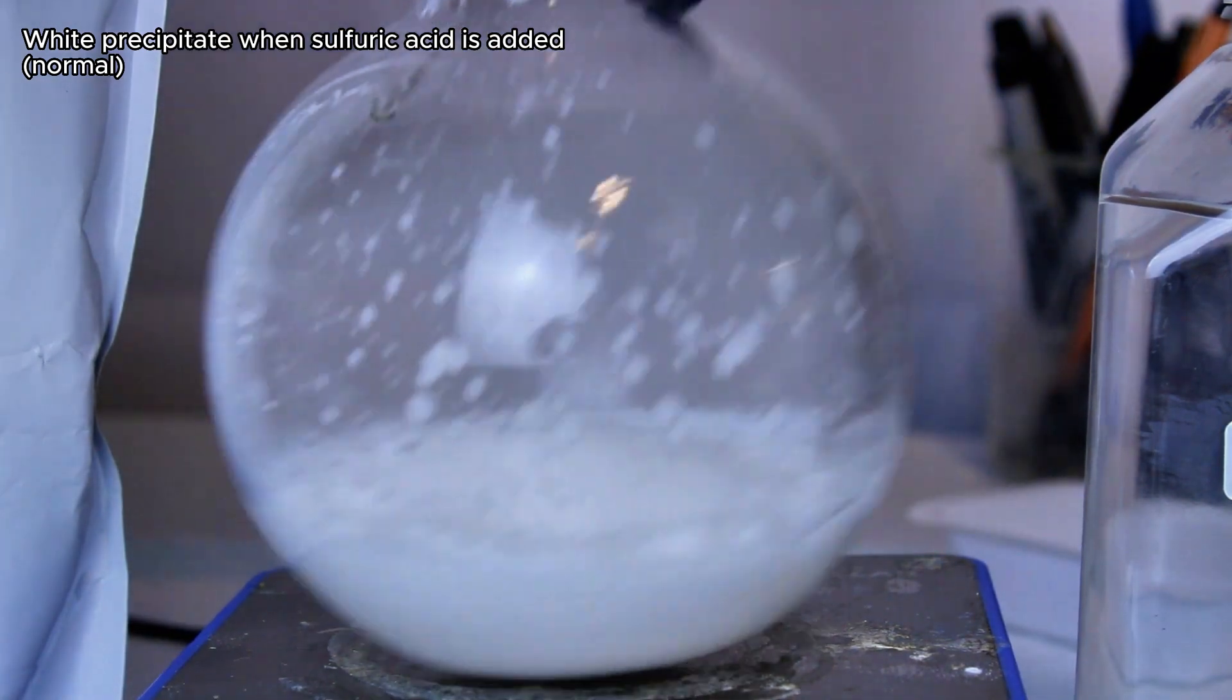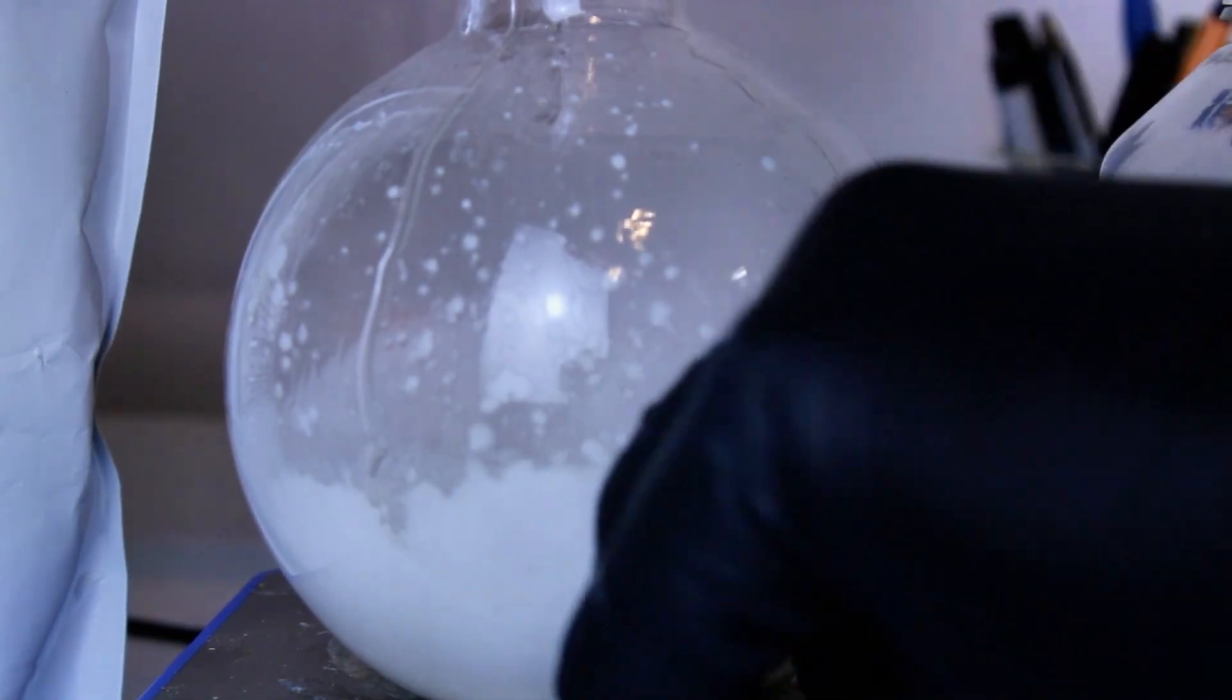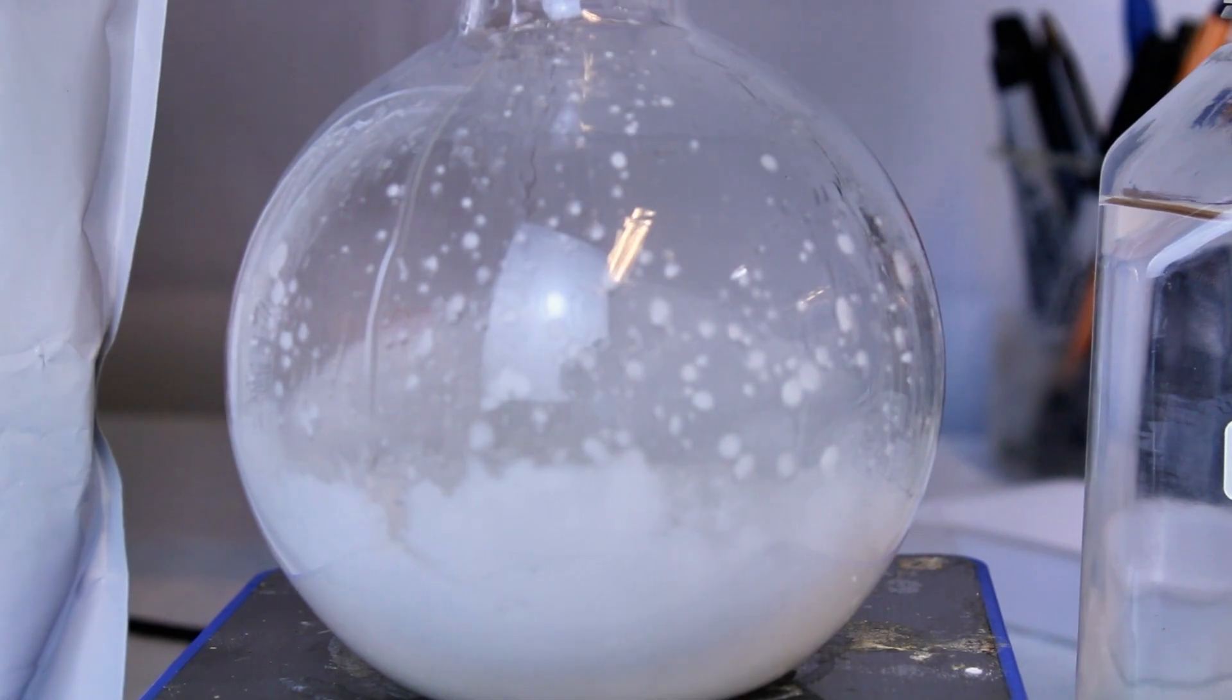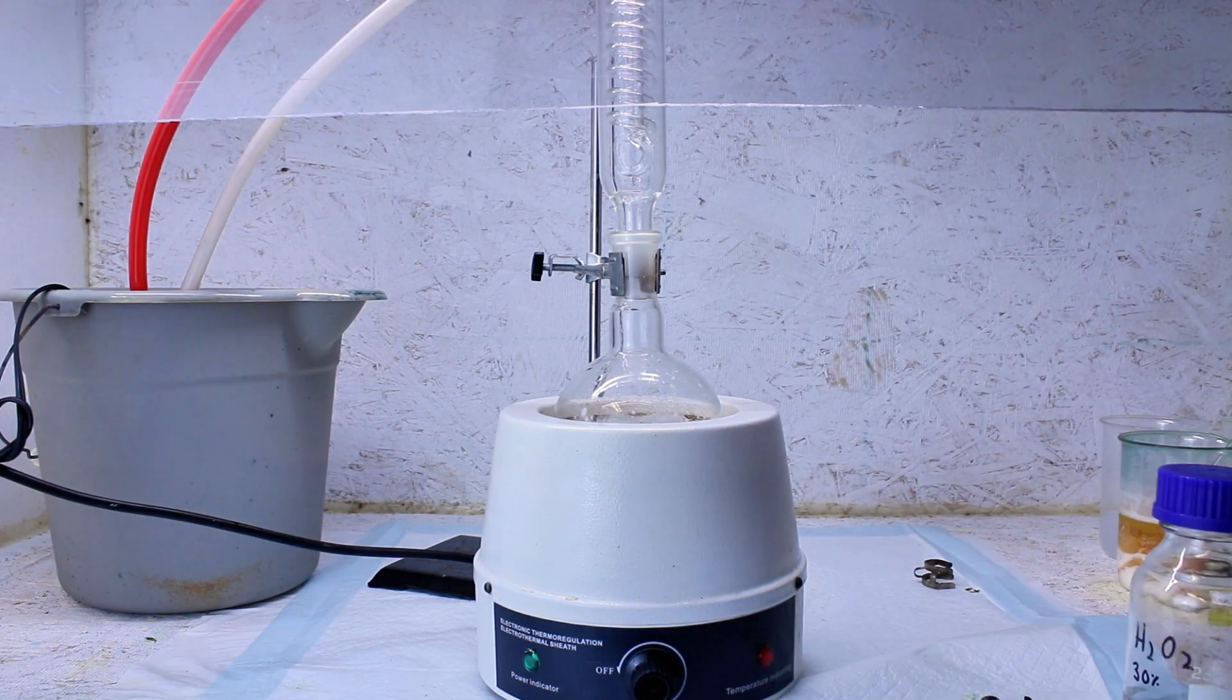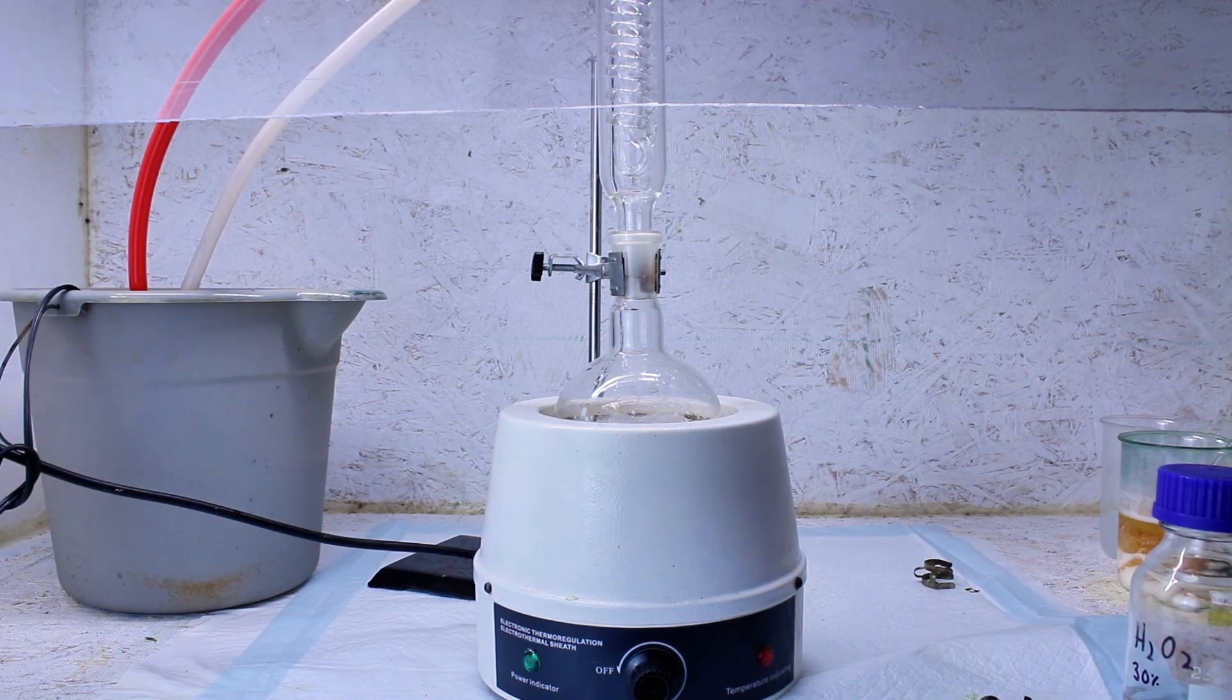In this case, the sulfuric acid will actually react with the PABA and form an insoluble complex, but don't worry about that, it's totally normal. I then set this up for reflux in my heating mantle and crank the heat all the way up.